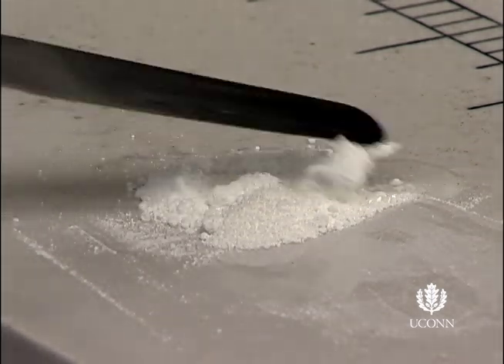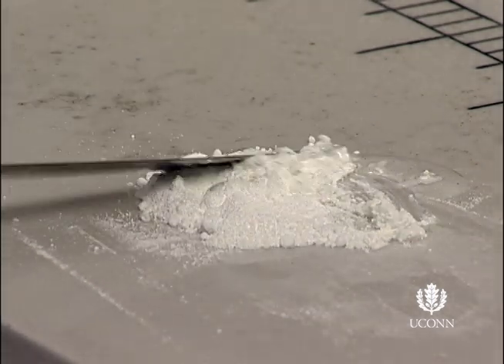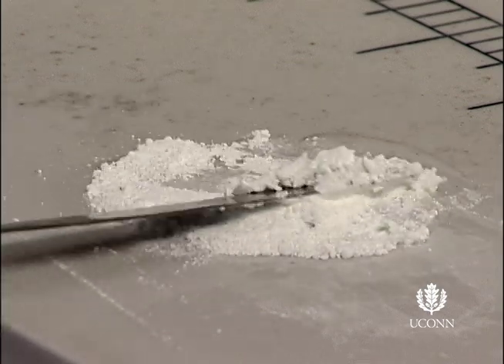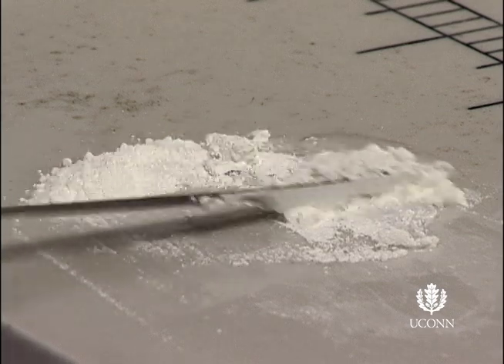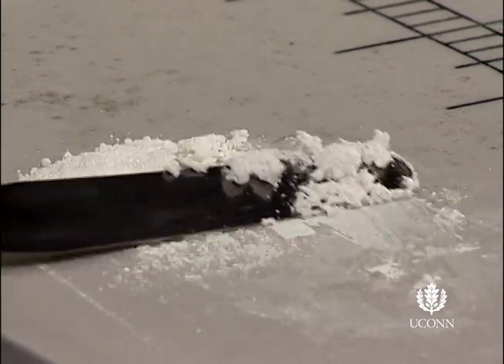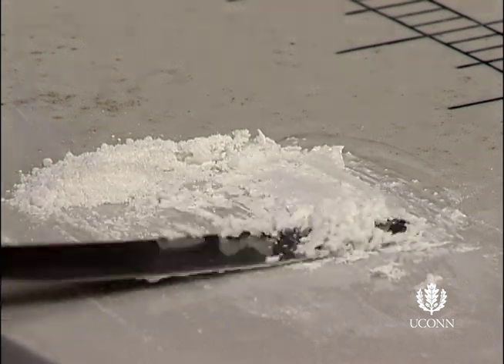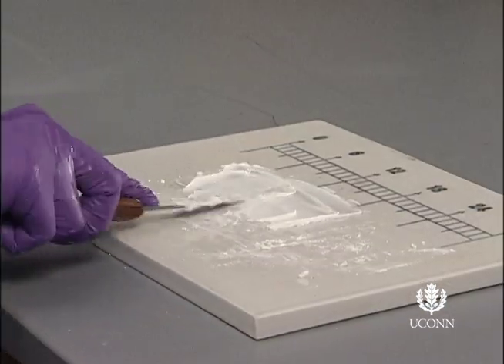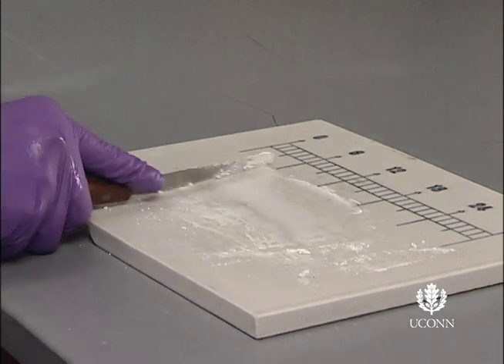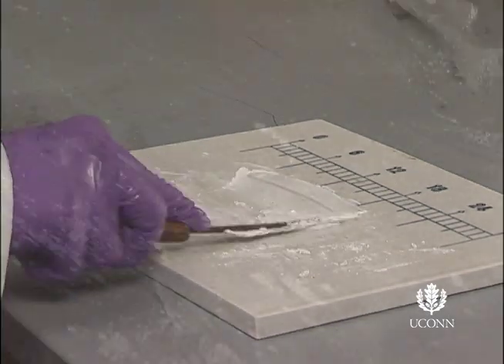Choose a levigating agent that is miscible with the ointment base. A liquid polyethylene glycol works well for aqueous and oil and water emulsion bases, while mineral oil works better for oleaginous or water and oil bases. Simply put, levigating agents make incorporating solids easier, and they usually yield smoother, more homogeneous products.